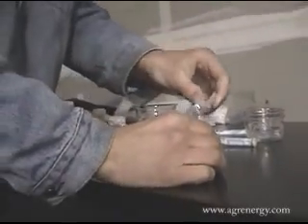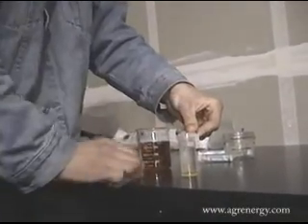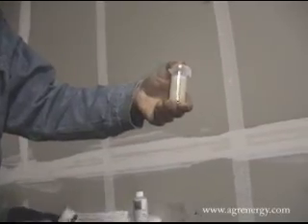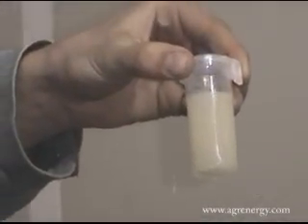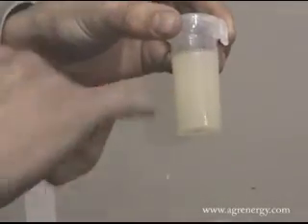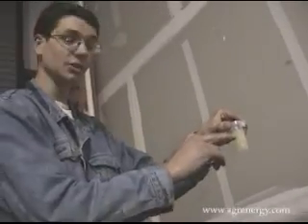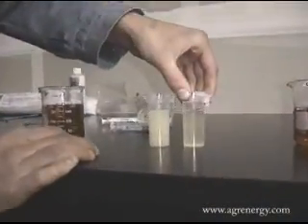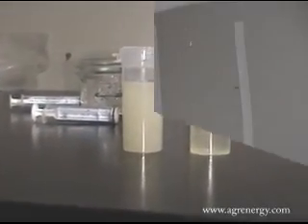And just like last time, we seal the lid completely, close the safety snap, shake it up, and we see a tremendously foggy appearance. This is due to the fact that this sample has not dissolved well into the methanol. So this fogginess is caused by small globs of undissolved fuel floating around in here. We see a very marked difference between this and the sample that's likely to pass ASTM.